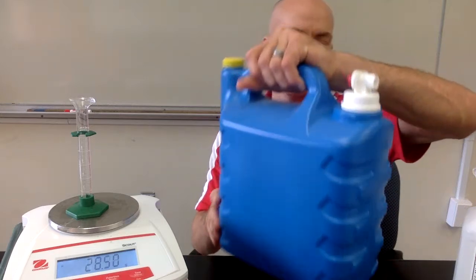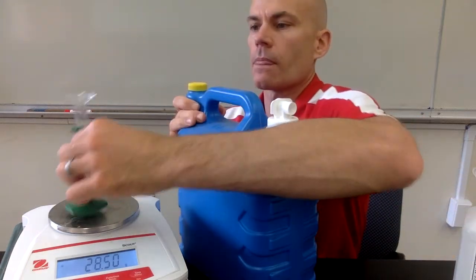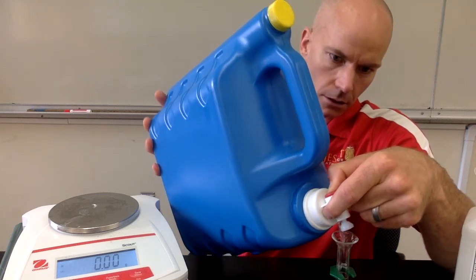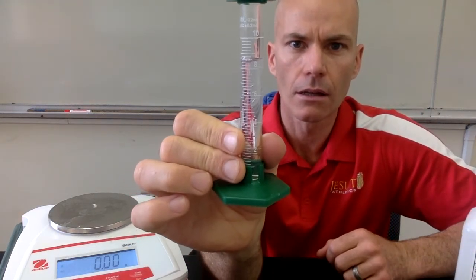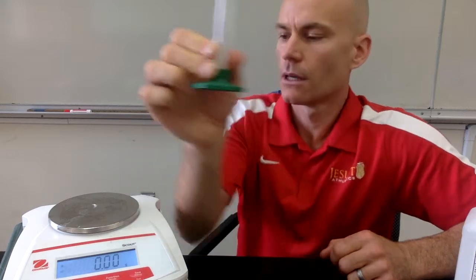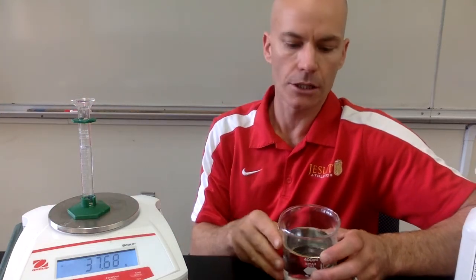All right, and then last substance, we are going to look at a sample of detergent. This is clothing detergent. And so we get a mass of our empty container. And then I'll take that off and I'll fill it with detergent. So we're getting a sample of liquid clothing detergent. I'll hold that up so you guys can see the volume there. It's got a few bubbles in it, but hopefully that'll be accurate enough. And we'll put that on our balance. You get the mass of our detergent.